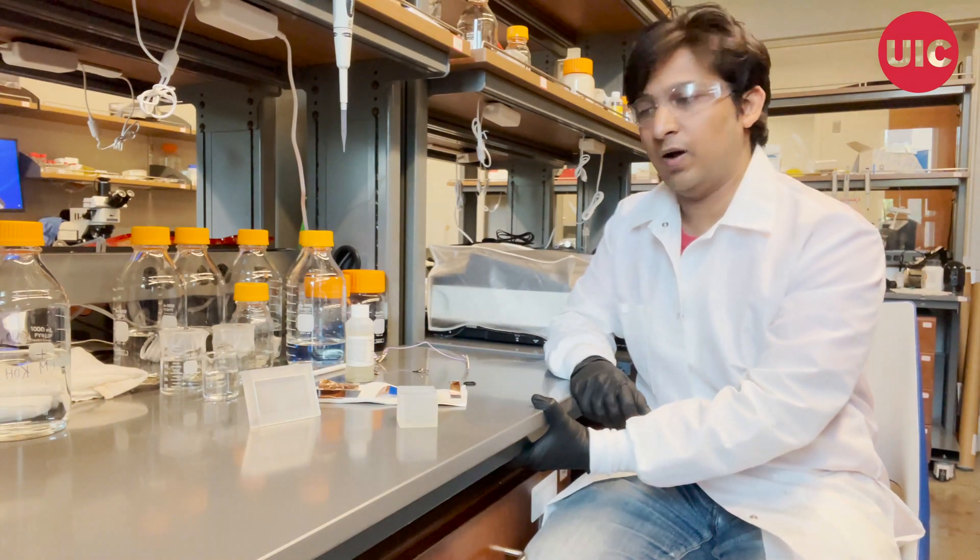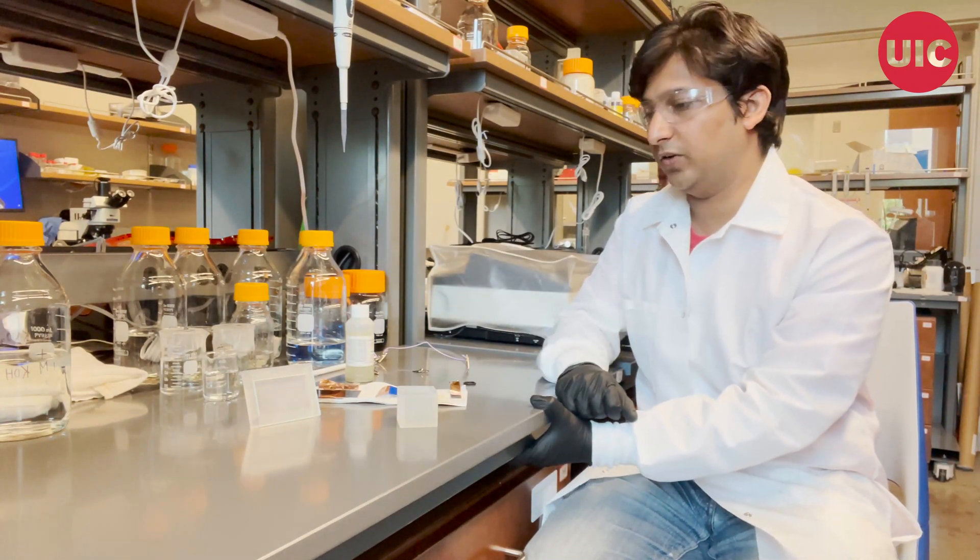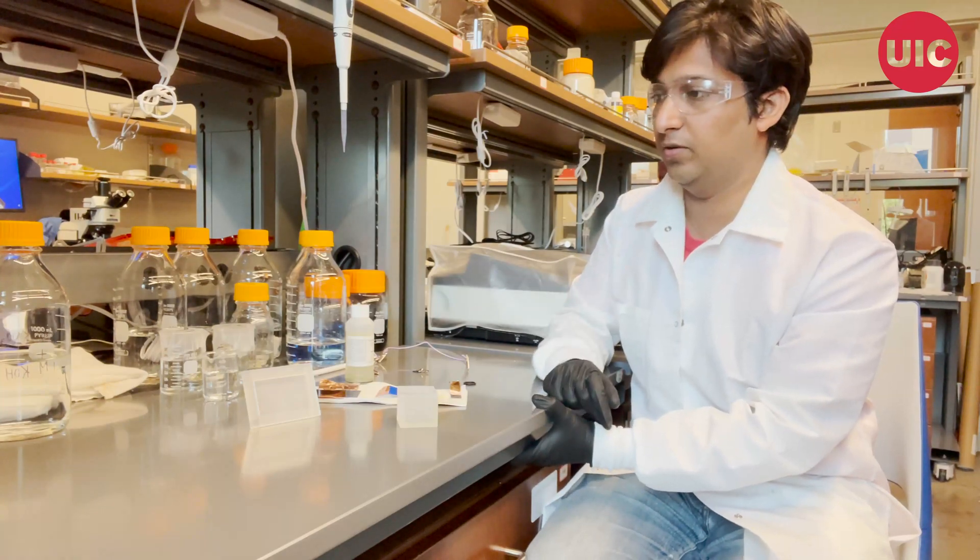I am Aditya and I am going to show you how we assemble this electrochemical cell for chemical reduction of nitrates to ammonia.